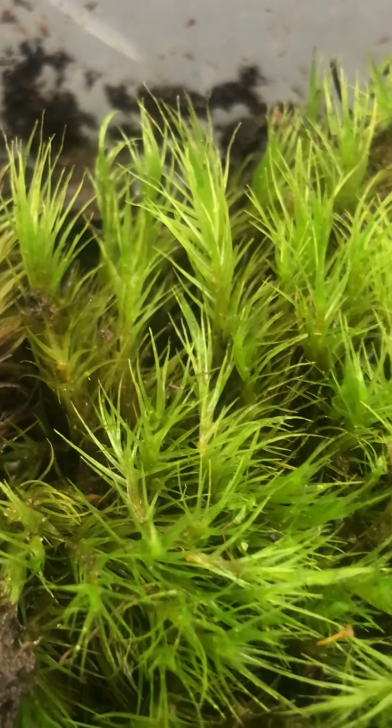Now, moving along to something that is a bit more traditional is a moss. This particular species of moss is called Mnium. You don't have to worry about that. And again, this is in the phylum Bryophyta. And much like we saw in the Marchantia, the green portions, you see here, the thallus, is the gametophyte. It is haploid.